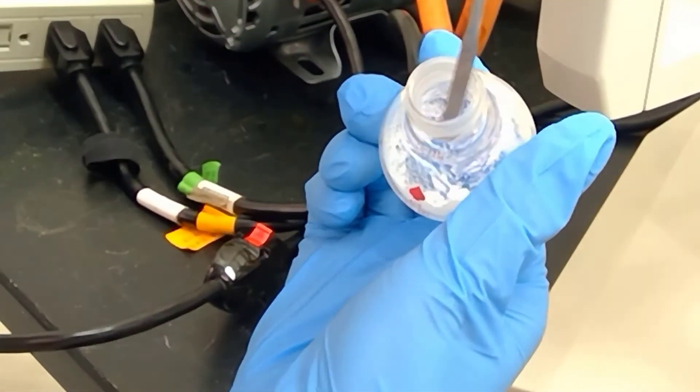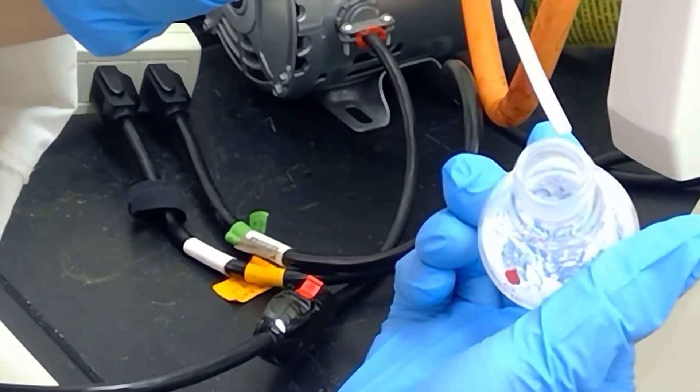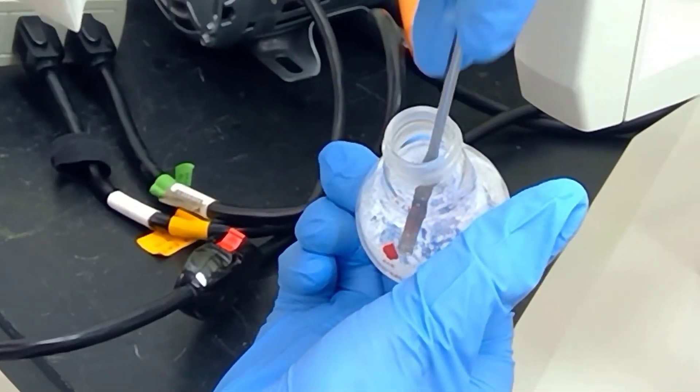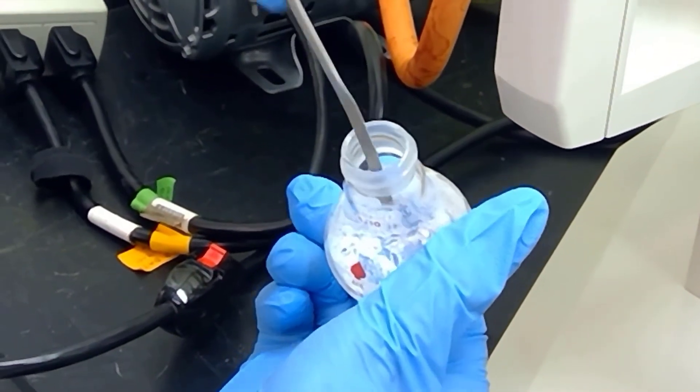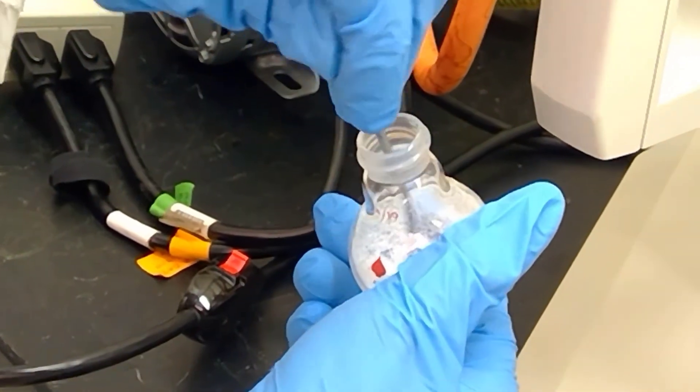I have a small bit adhering here. The goal is to ensure this isn't pasty - when it's pasty, it's very difficult to work with. This is just a test to see if I need to rotavap a little longer. This seems to be just fine.